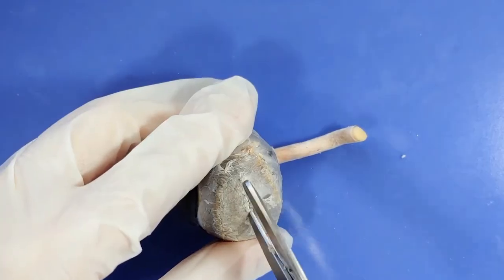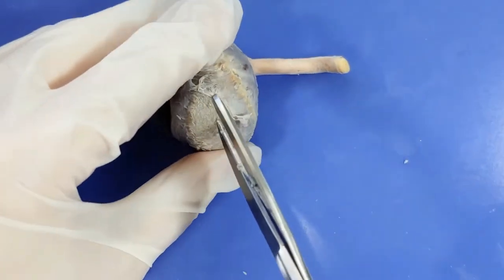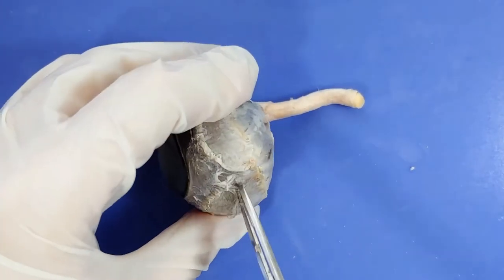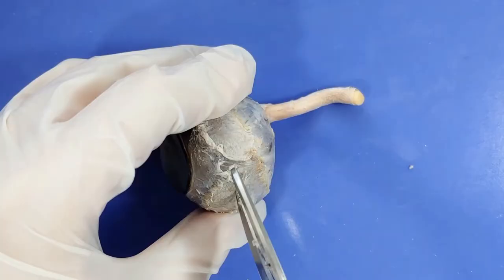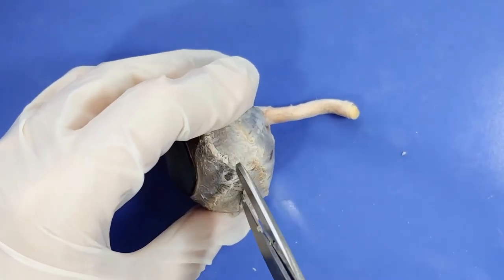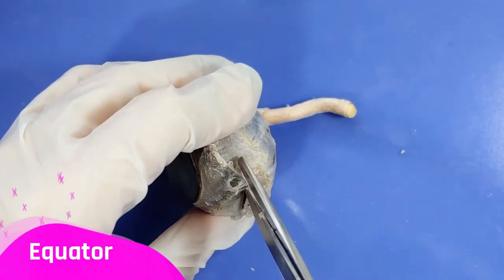Now we're going to cut open the eye to get a better look at the internal structures. I'm going to cut just along the middle. This midline is called the equator.